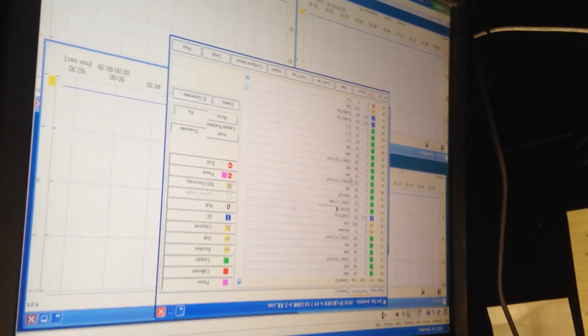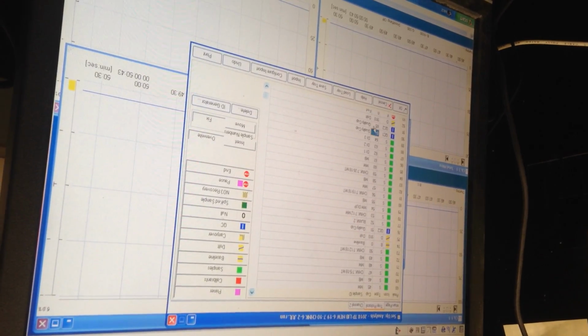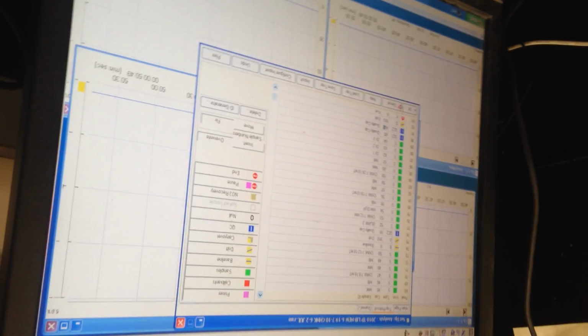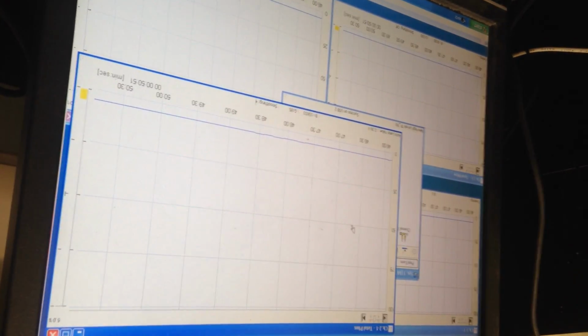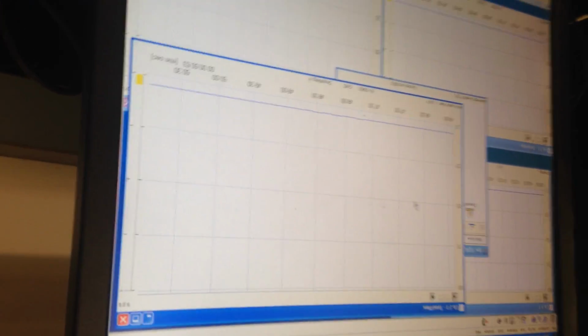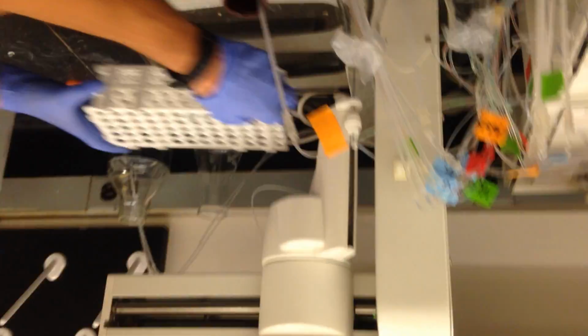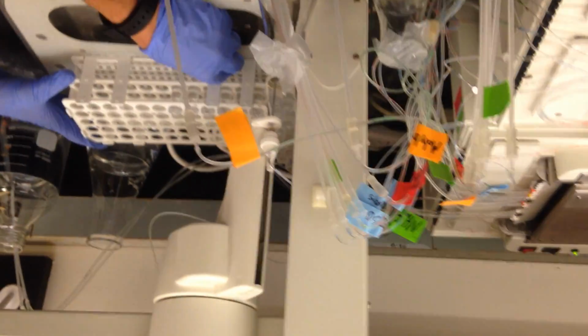One, two, three, 4, 6, 7, 8, 9, 6, 1, 2, 3, 4, 65, 66. So now we just wait. We're pretty much ready to go as soon as that spike comes through.